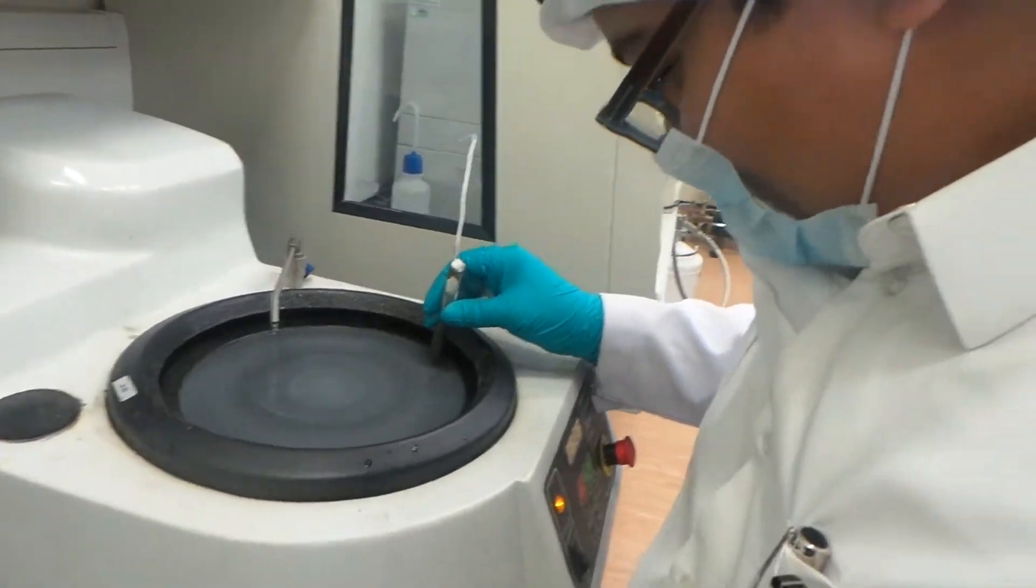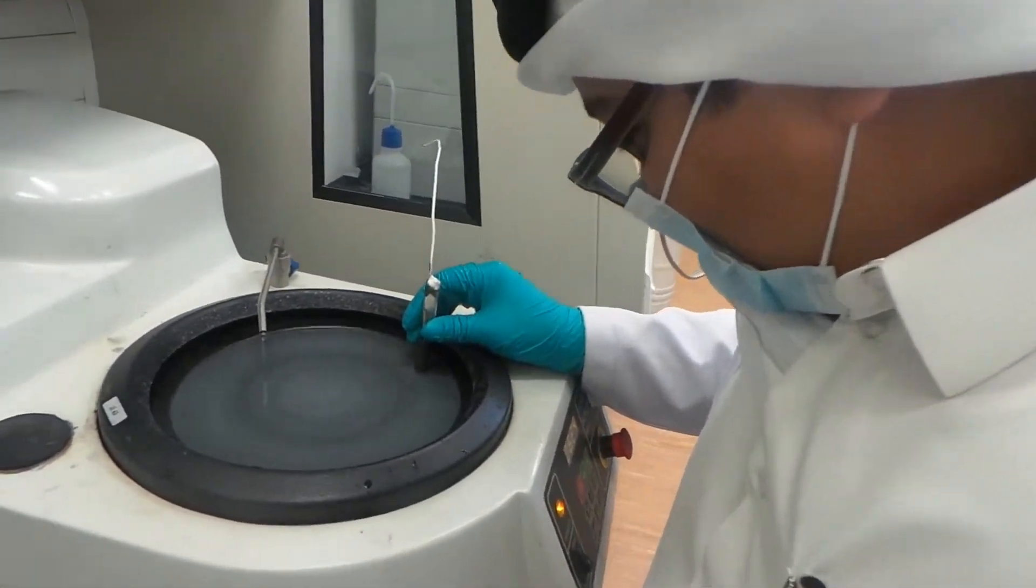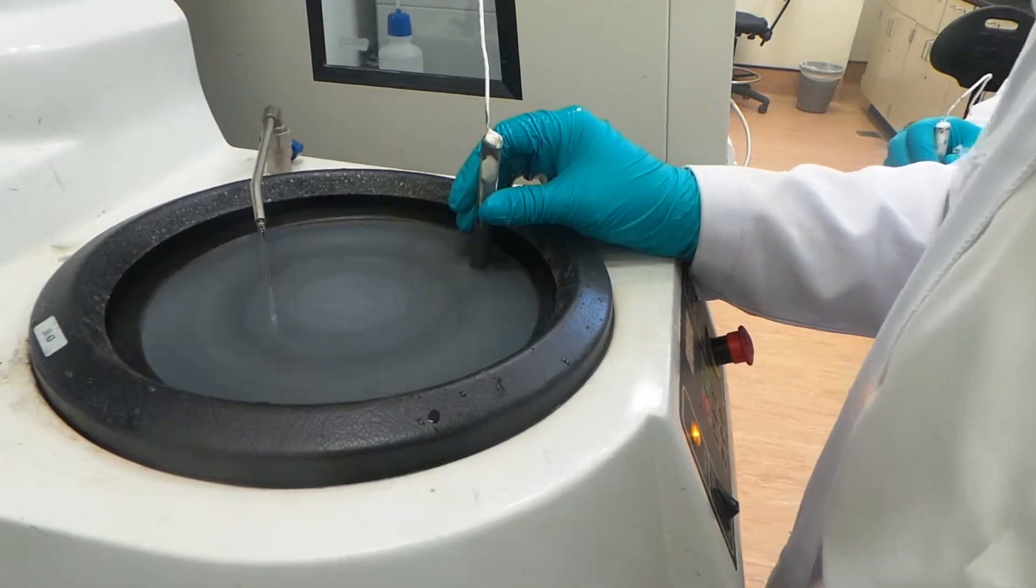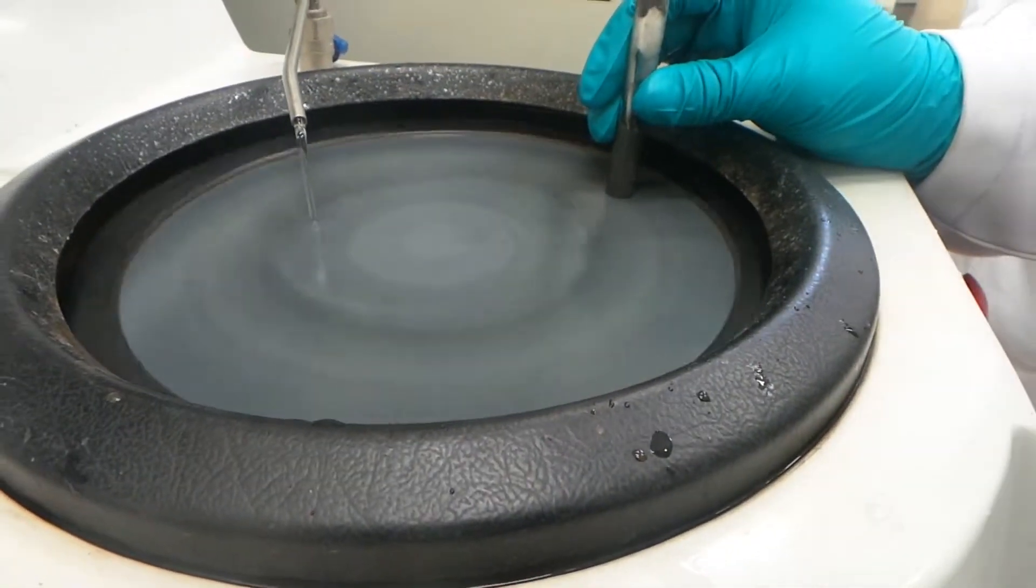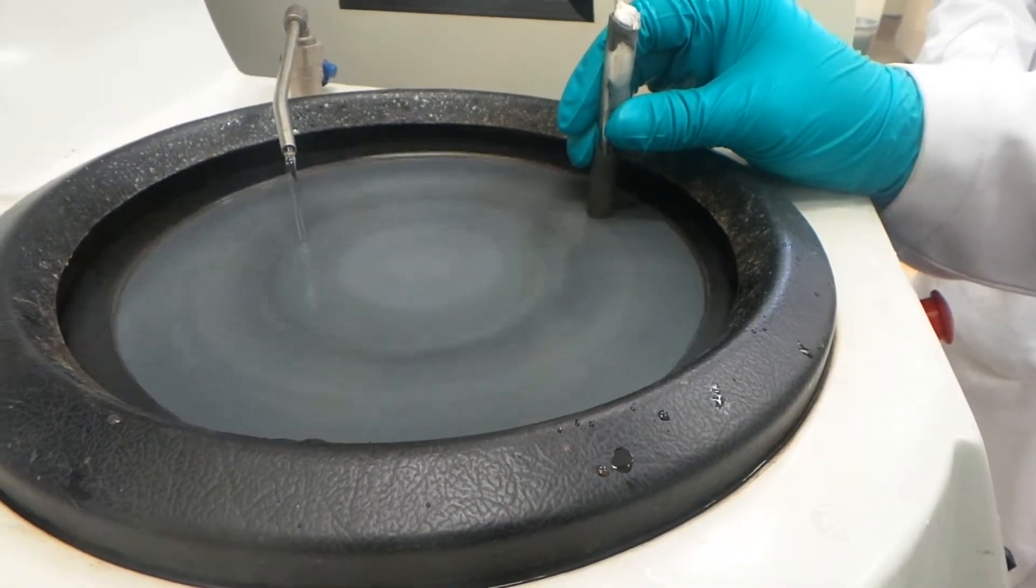Hi, it's me, Sioud. Polishing the surface of electrode is a must when you're talking about dipping it in acid. We don't want any other unexpected chemical reaction to it here.